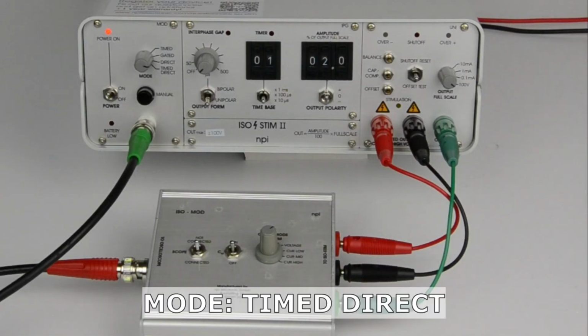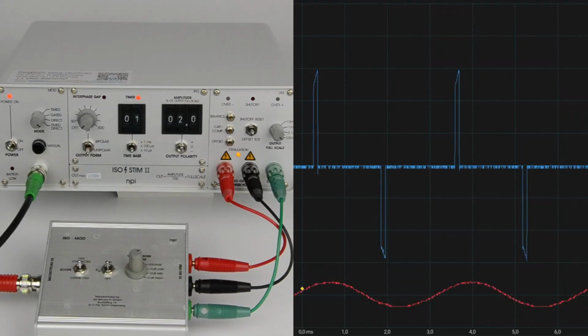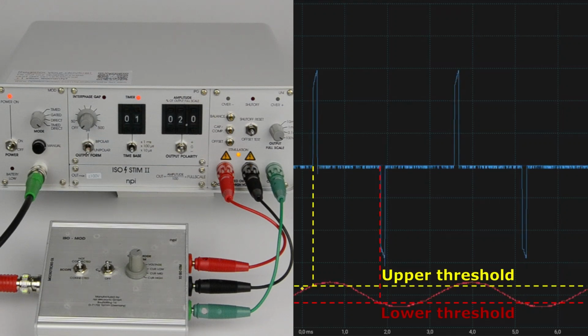Now we switch to timed direct mode. This mode is used for pulses of a defined length, but with variable amplitude. We demonstrate this with a sine wave as input signal. Note that there is a certain threshold before the output signal is triggered.